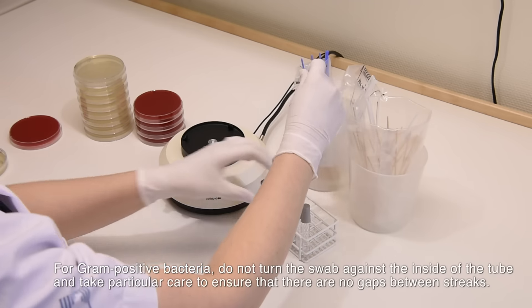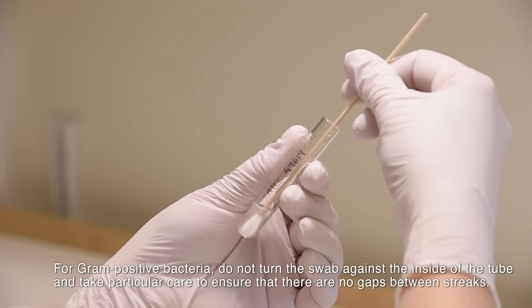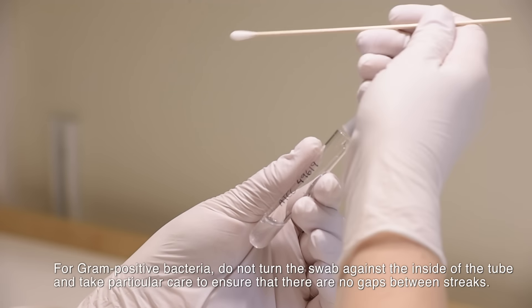For gram-positive bacteria, do not turn the swab against the inside of the tube, and take particular care to ensure that there are no gaps between streaks.